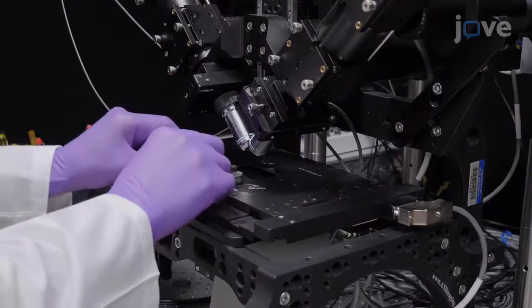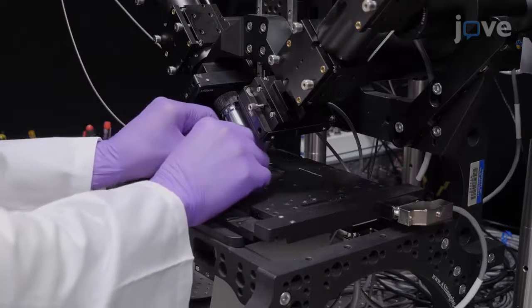Then place the steel imaging chamber into the sample holder on the stage of a DISPIM.